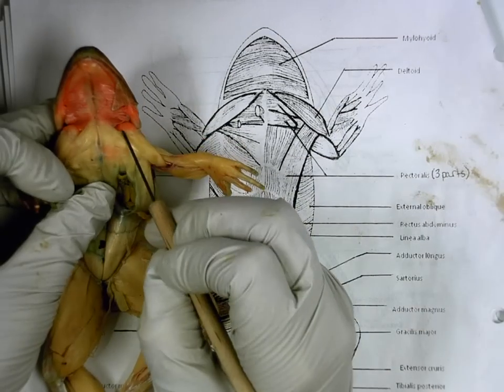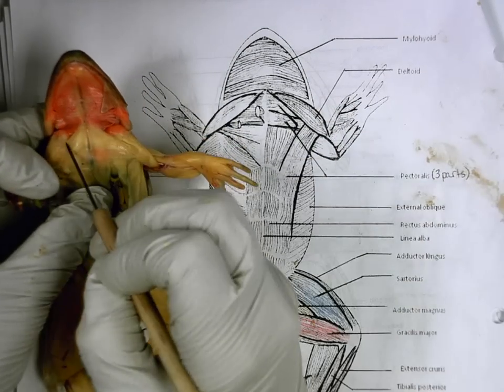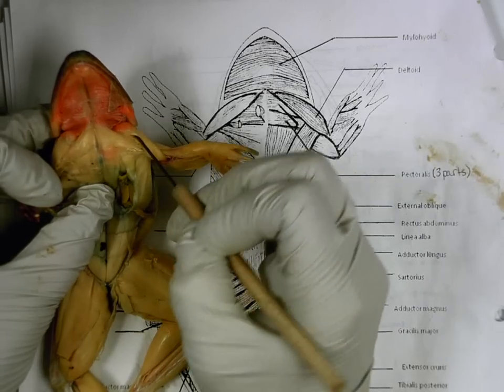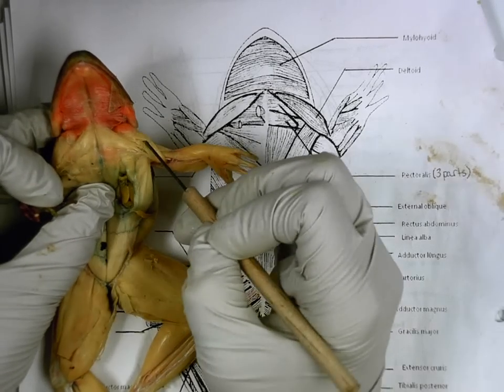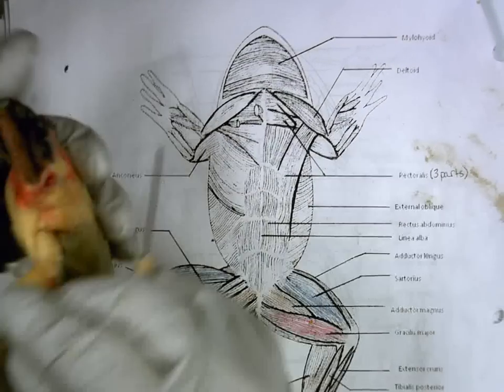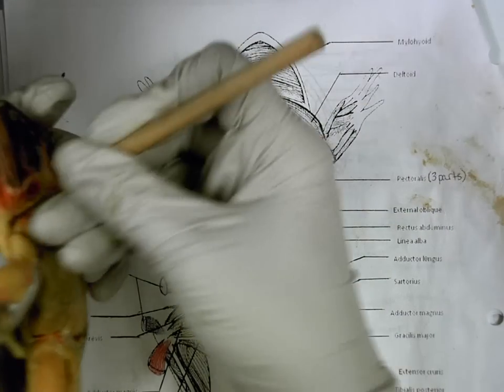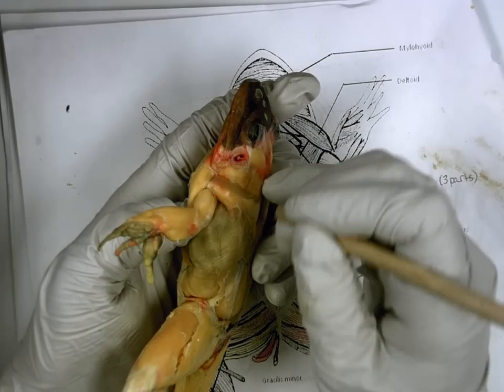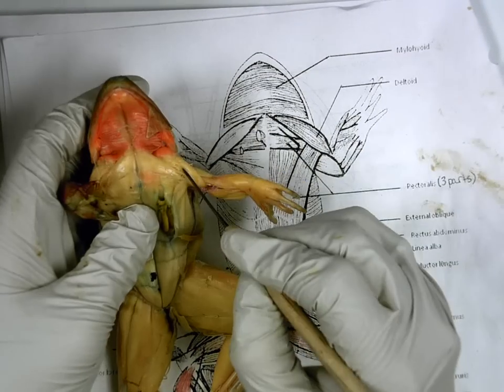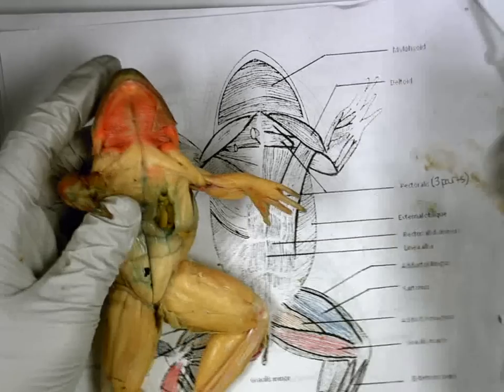Then we have this big shoulder muscle. It's kind of going across the chest and up by the shoulders. These ones? Deltoids. Again, if you rotate, you can see it from the back because it kind of goes over the top of the arm. So that's the deltoid. Big deltoids.